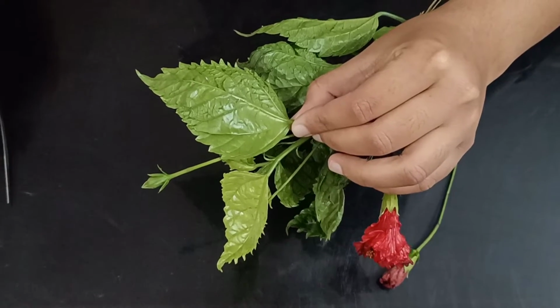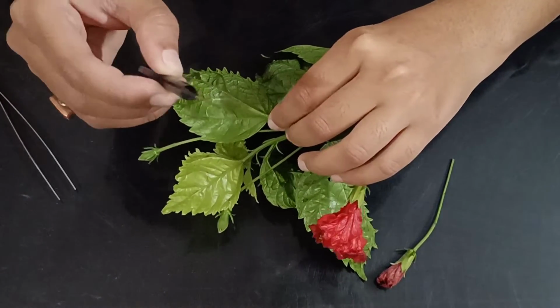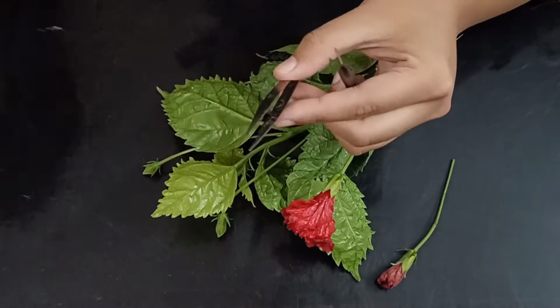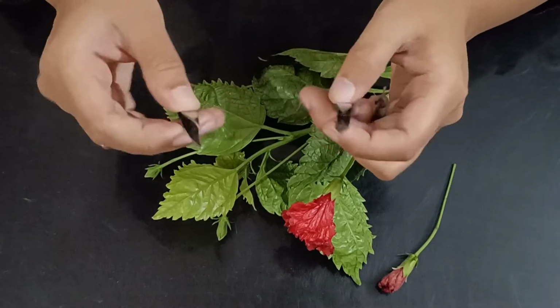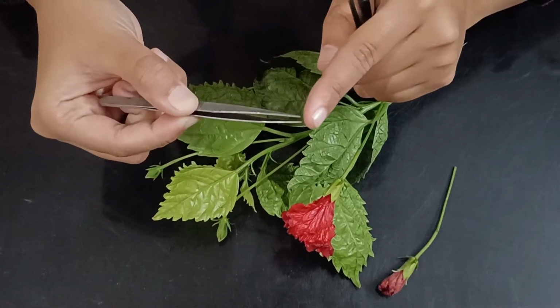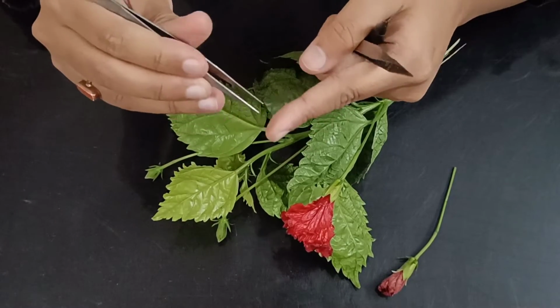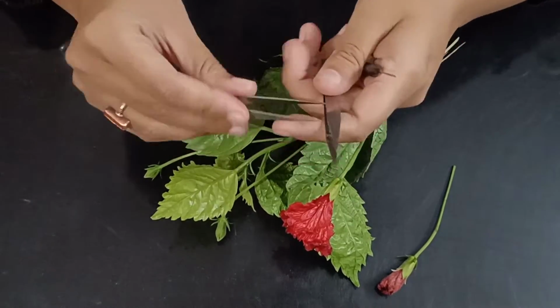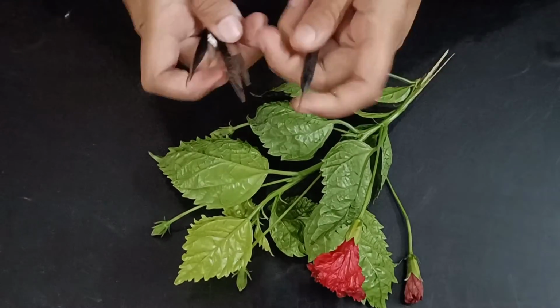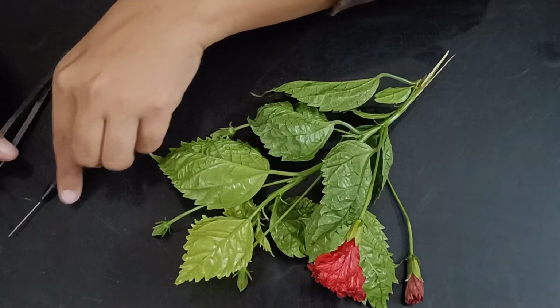So we are going to use some tools. Firstly, this is the needle, okay? And this is the forceps. Basically, for any forceps that you have to use for biological purposes, you will see the tip is very much pointed. Only pointed tips can be used for dissection purposes in biology. So we have two forceps and one needle. I am going to take all these instruments to show you all the dissections, right?